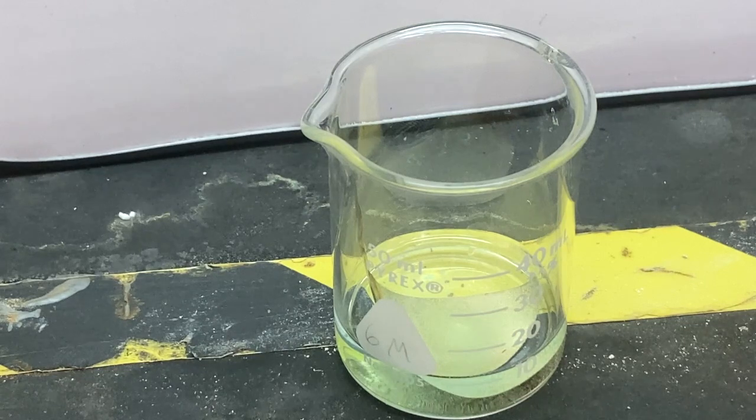This is happening inside of a fume hood because the brown gas that's coming off the top of there is toxic, and the acid is a pretty strong acid that will dissolve lots of things. This actually happens pretty quickly, relatively speaking, but it's going to take about 10 minutes, so we're going to speed up the video in a sec and we'll watch this happen at high speed.